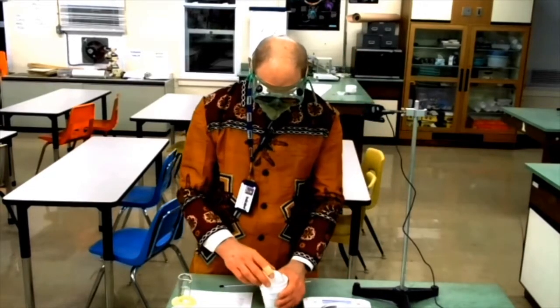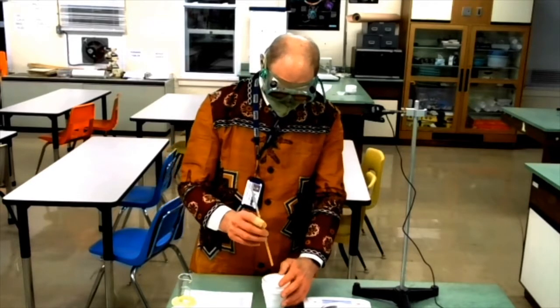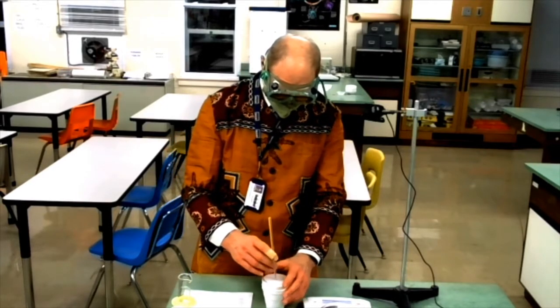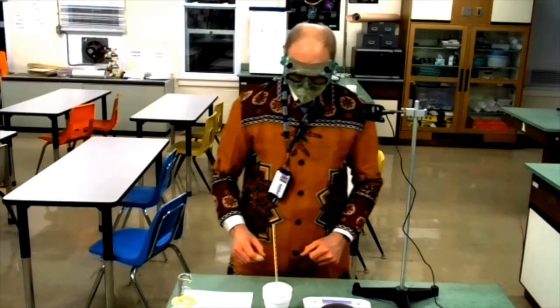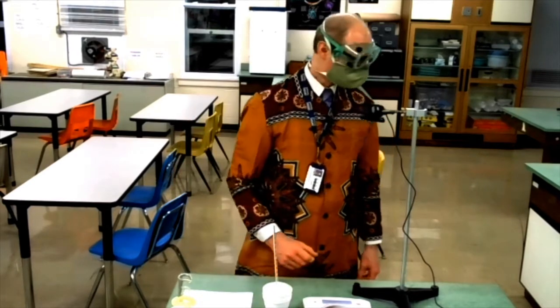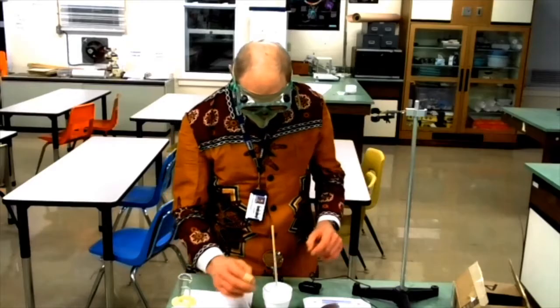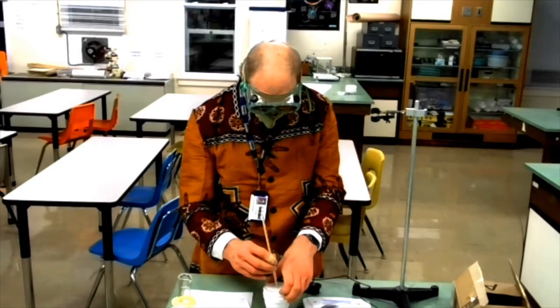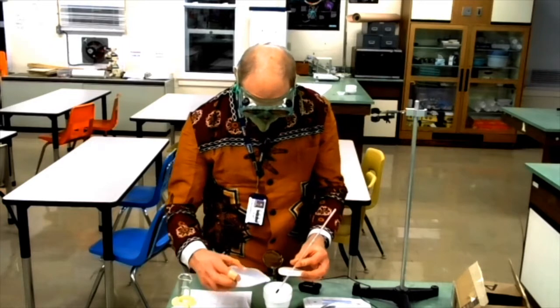The next thing to do is measure the temperature. I'll let that equilibrate and give it some time. I'm going to call that 21.5 degrees Celsius. Now I'll add the salt.